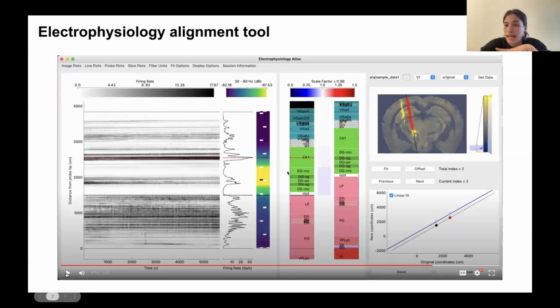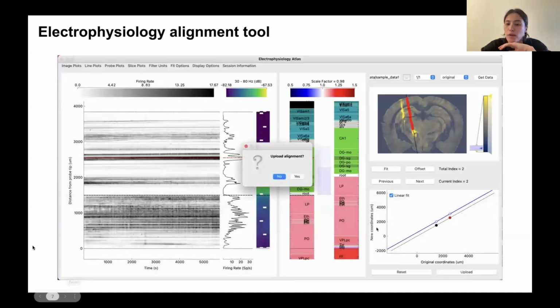So you can continue to add as many reference lines as you see fit to continue with the alignment. And once you're happy with it, you can then press this upload button. It will then save the new channel locations on disk in a JSON file that you can then access and read in to do your analysis.